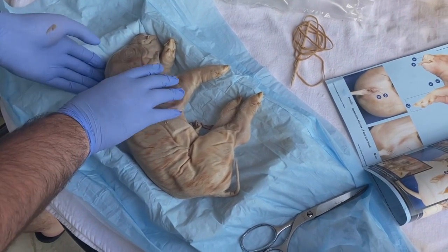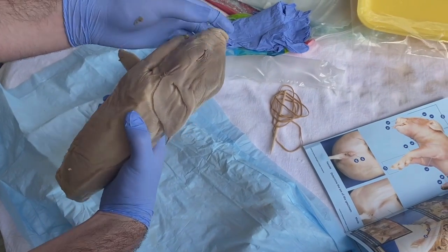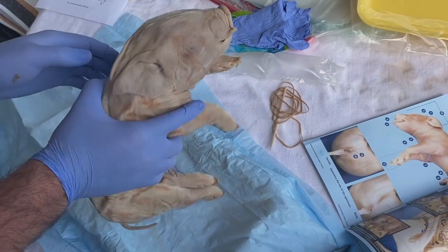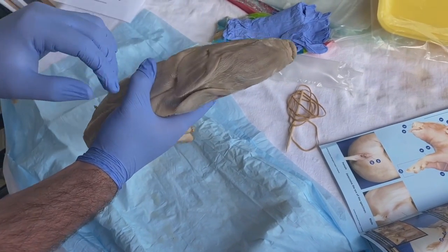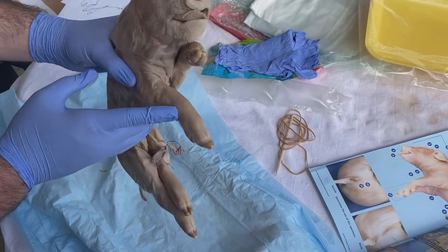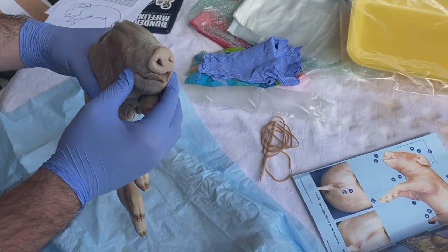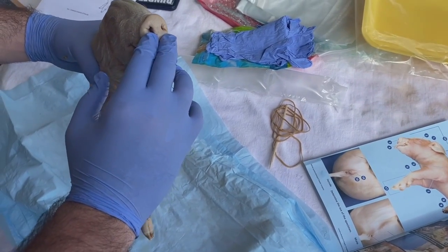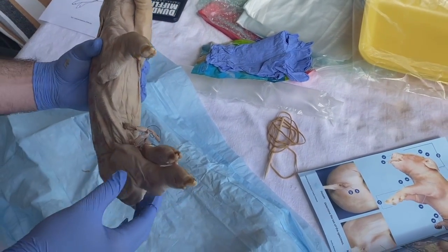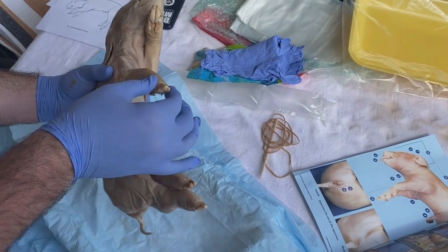So here we have the eyes of the pig alongside the external ears, the mouth, and then the nose with the 2 nostrils right here. See, all 4 appendages of the trunk have hooves.